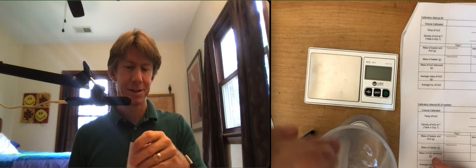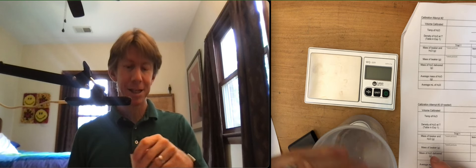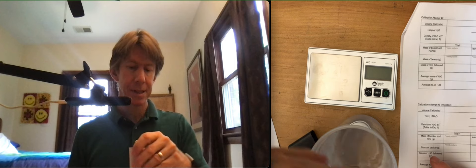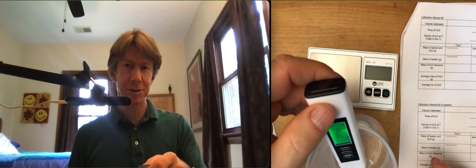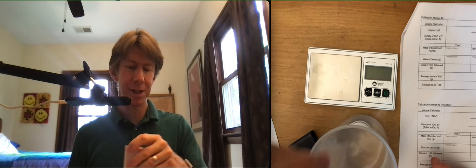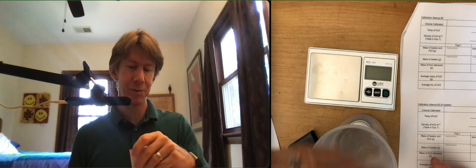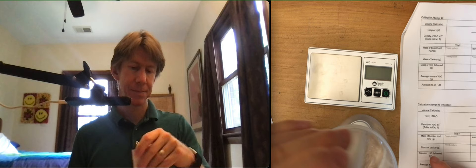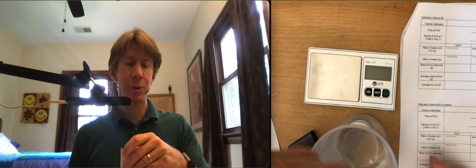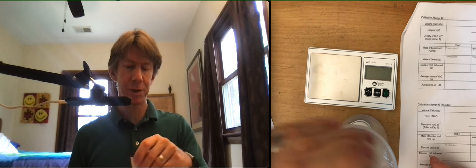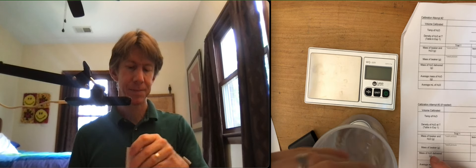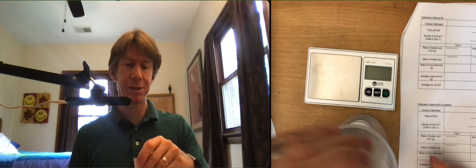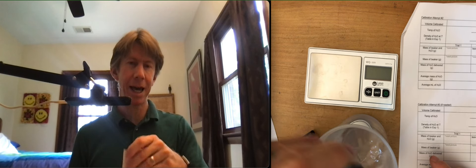While I'm stirring, you might want to fast forward through this part. This is the not exciting time of science. Although it is interesting. I mean, so my temperature is going down. It's at 20.3 right now. I know it was at 20.0 before. And it went pretty quickly down. So it was at 21.5 when I started.